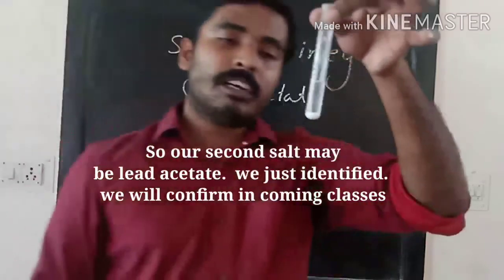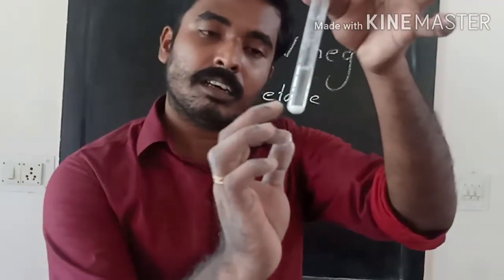After some time, the test tube will be like this. That precipitate will settle.